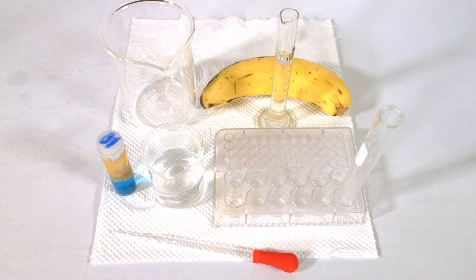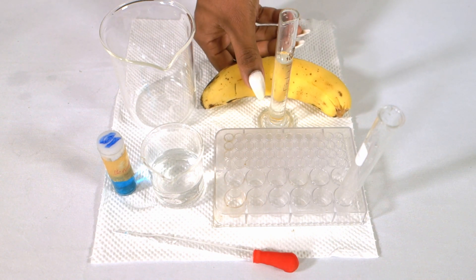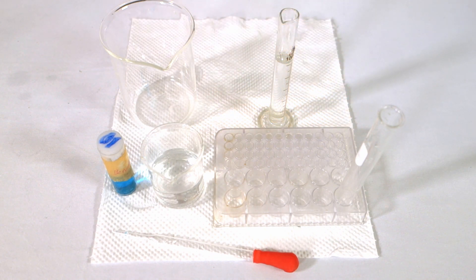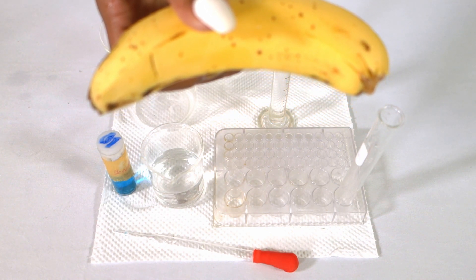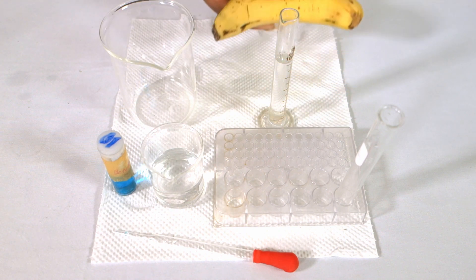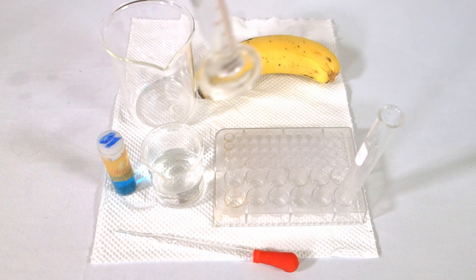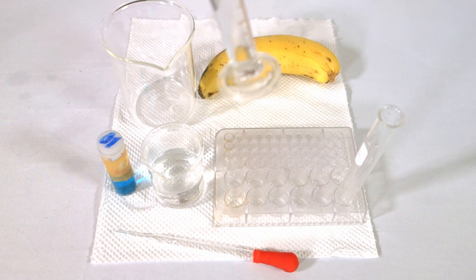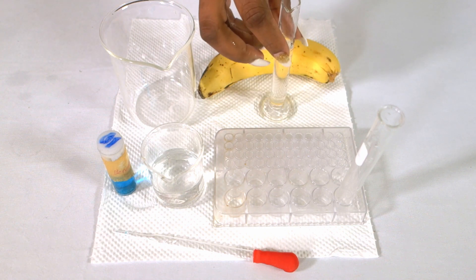We are going to be doing the reducing sugar test in this experiment today. We are using banana, commercial glucose, and water as our control.